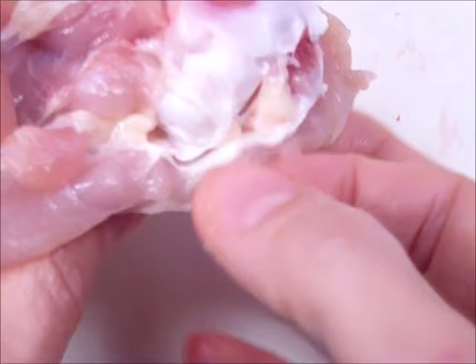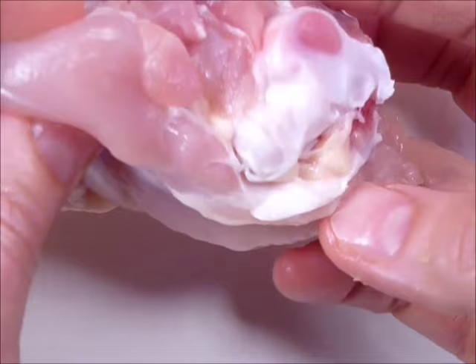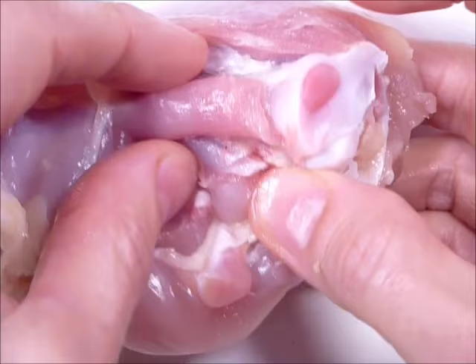You can see how this is all surrounded. There's a surrounding piece. Our bodies are not that different from chickens biologically speaking — we would have these same features.